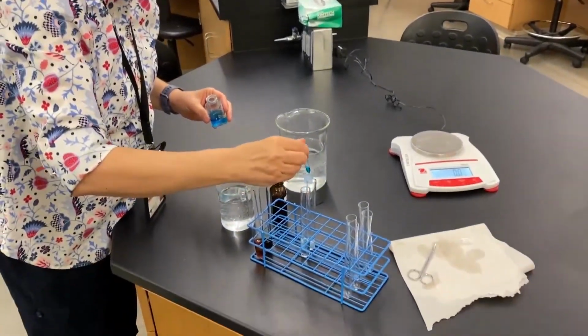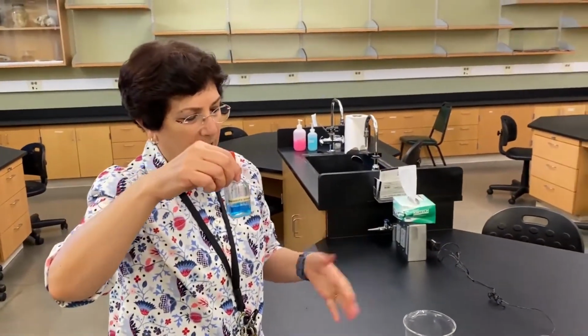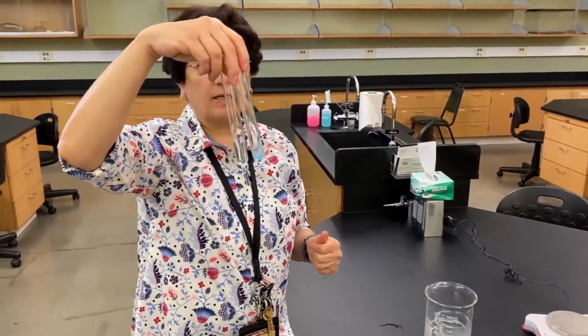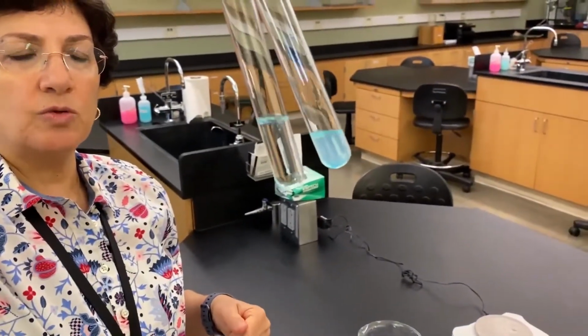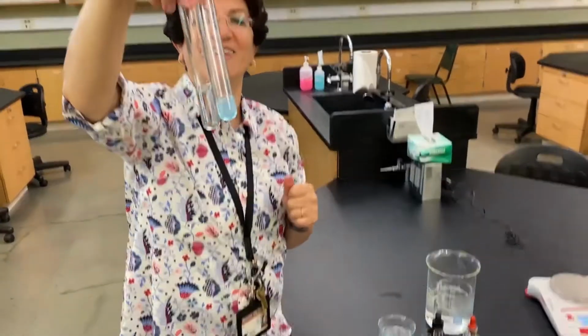So again, I'm going to put a couple of drops. And Benedict, it's one of these solutions that if you were in lab and you're using these tubes, you cannot really dump in the sink. We have to dispose of it in a special container because we don't want this to be going into our system. What do you call it? The sewer. The sewer, sorry.